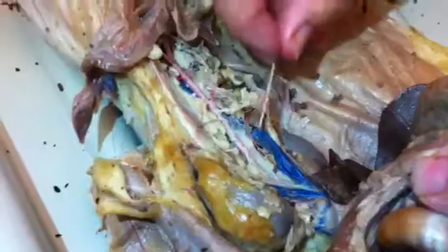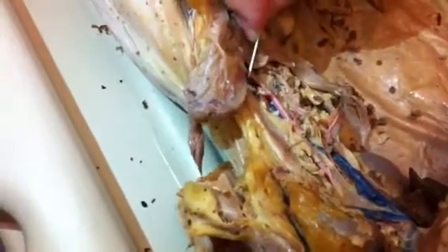Okay, coming down here we have the... Now this is neat because this is where the switch was. See how they cross? Usually, always, veins are to the exterior. But then we switch here, and the vein goes to the back. So this is the inferior vena cava until it splits, and then it becomes the common iliac, right and left.